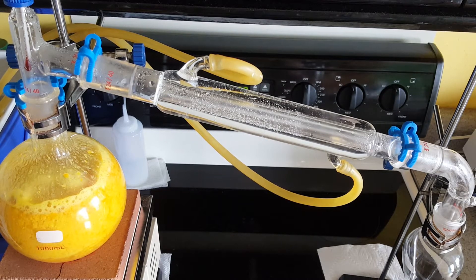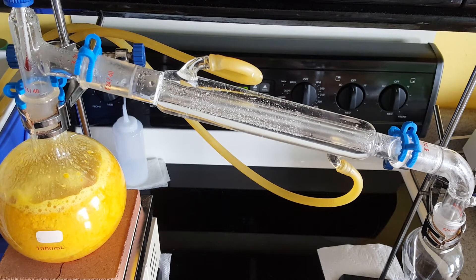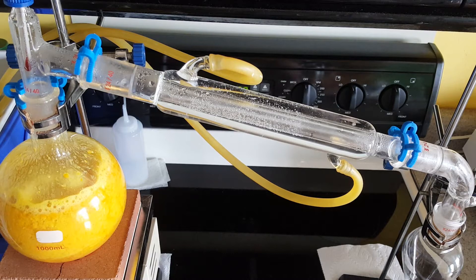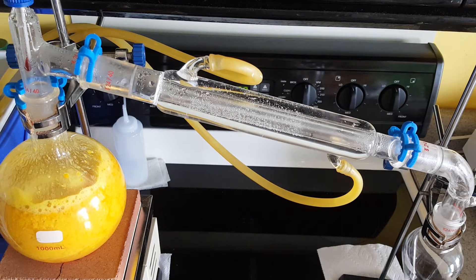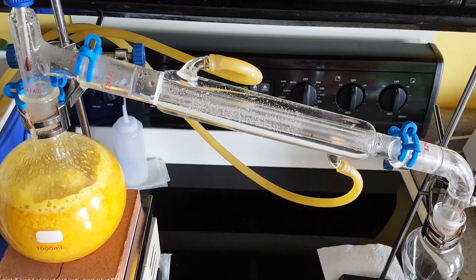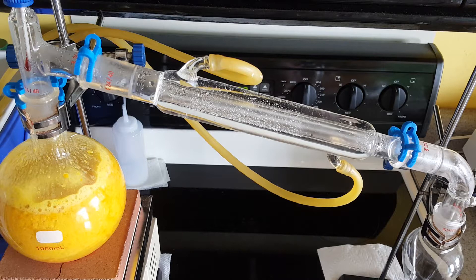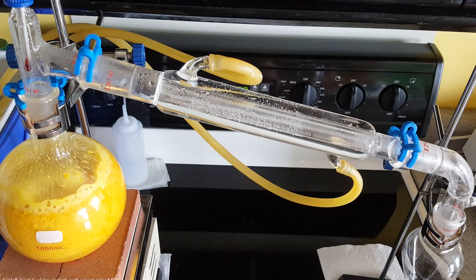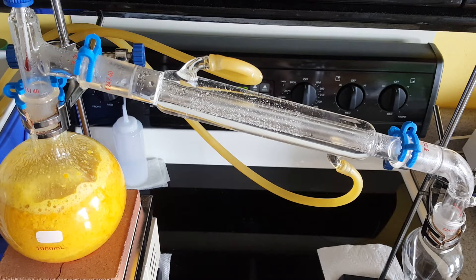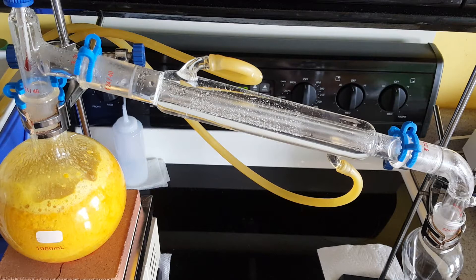My thermometer has reached 45 degrees Celsius now. It started at 25, so I have a 20 degree increase in temperature with a slight increase in volume. The actual boiling process will begin soon and hopefully I should start to see some vapor forming in the neck and in the condenser.